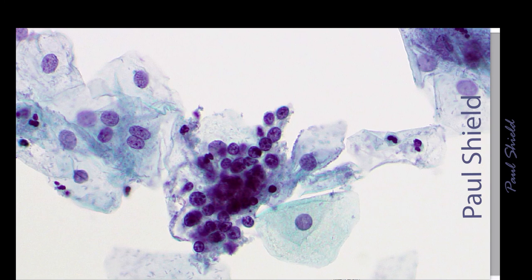If I look carefully at them, I really can't see any that have a squamous, well-defined border to the cytoplasm. Notice also in comparison to the intermediate nuclei around, these are really quite small cells. They're all quite round, but they're showing variation in size, and that's because they're lymphocytes of varying maturity.